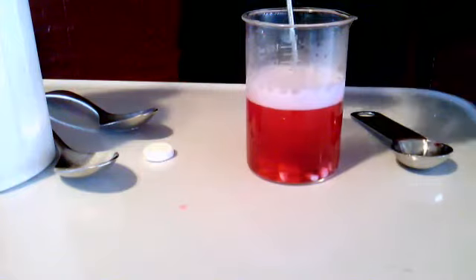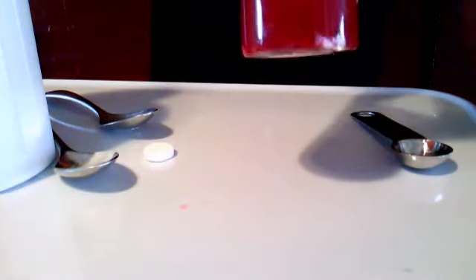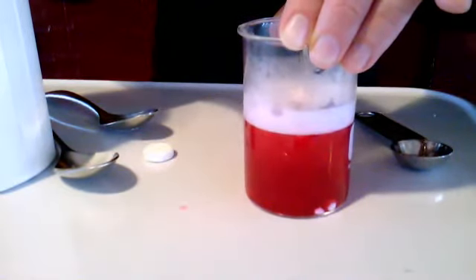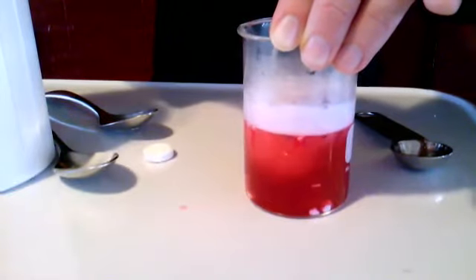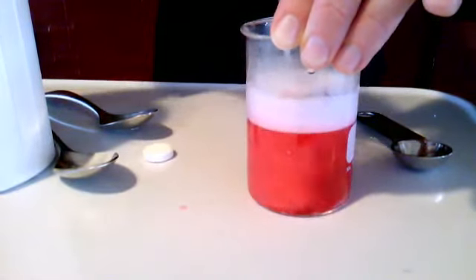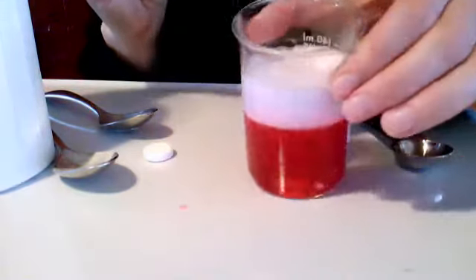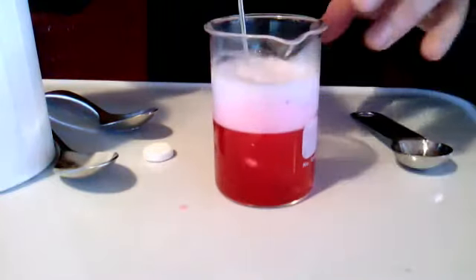We've got lots of fizzing. I still got a few chunks I'm trying to get. Usually when I chew Tums up, because I'm lucky enough to have had to take Tums, I chew them better than large chunks. I send them in as a bit of a powder into my stomach. So I'm just going to help them with my pretend chewing here. So hopefully you all have your butcher paper. Look at this. This poor person is burping like crazy. Look at all that gas they're making. And they're probably some juicy burps.